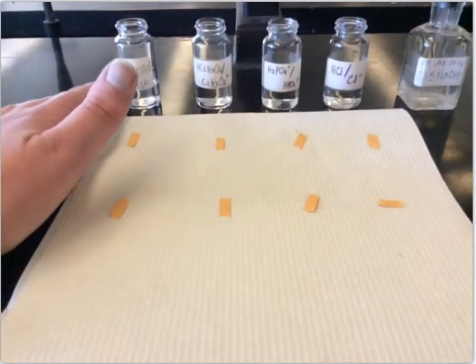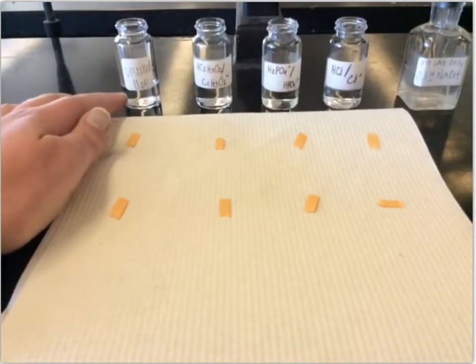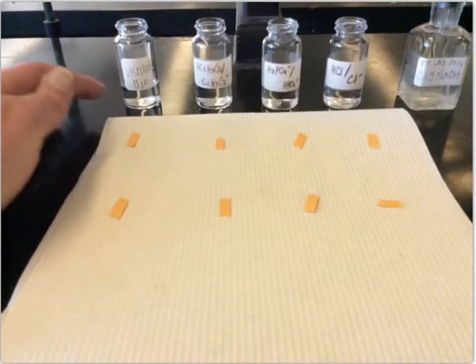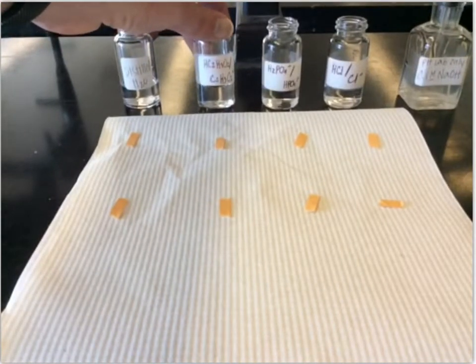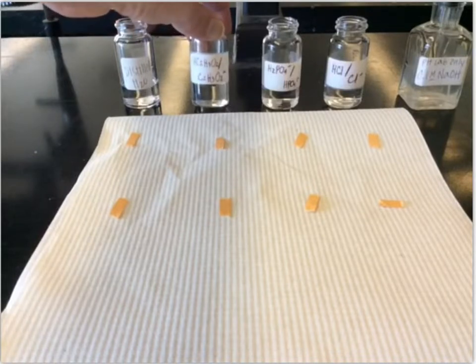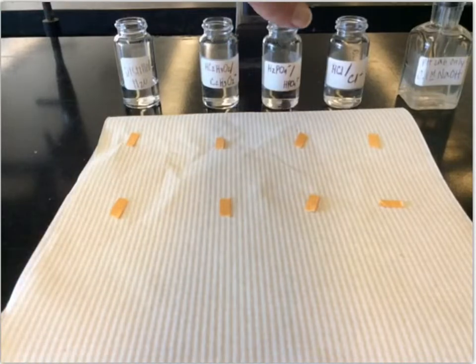So first we've got distilled water just to act as a standard, so you can see what the pH of distilled water is, and what the pH of it is after we've added some strong base to it. And then we have a solution of acetic acid and acetate ion, so HC2H3O2 and C2H3O2 minus. Of course, that means there's a cation in there as well, but that part shouldn't have an effect on it.